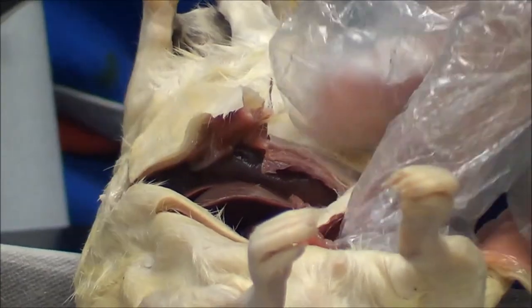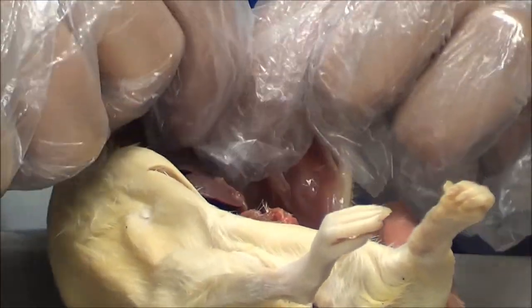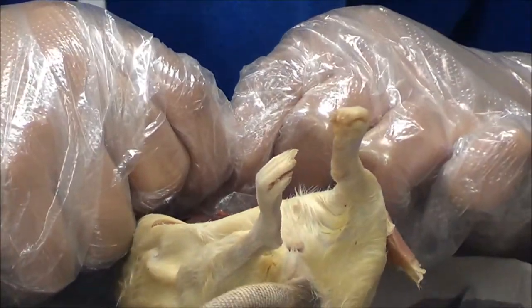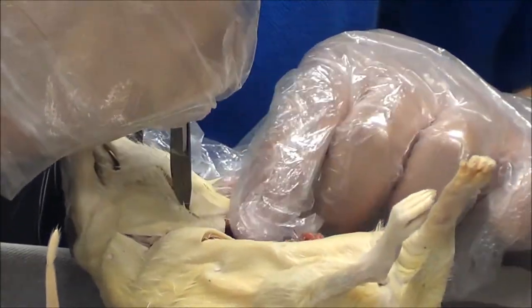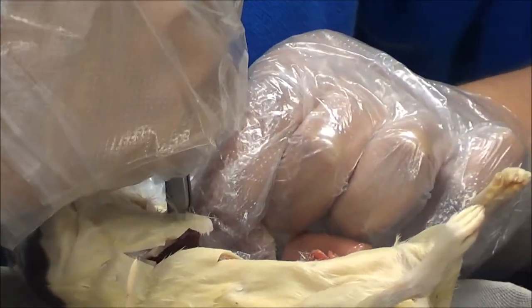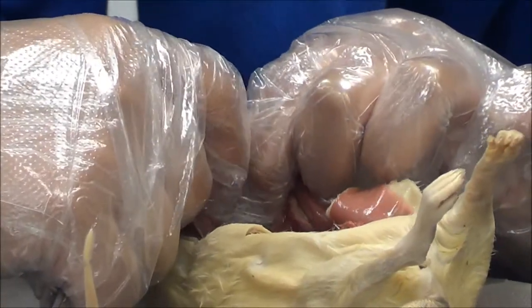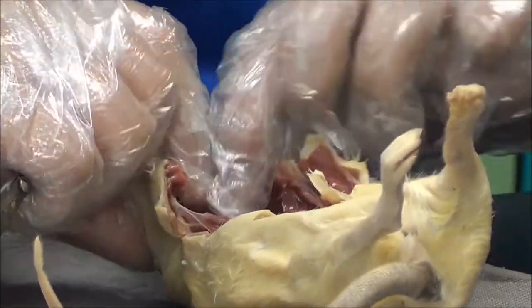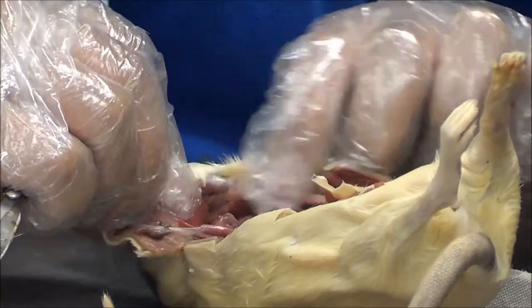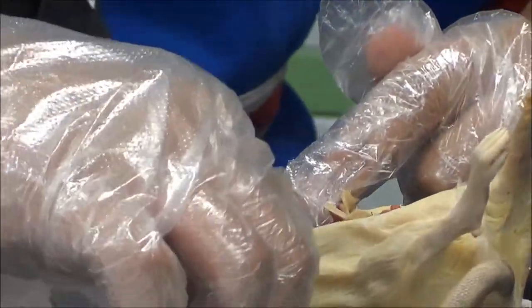Next, I will be making an incision in the rat's rib cage. First, we must open it a little bit wider and then make the incision — not too deep, of course, because you might puncture the heart. Once the rib cage is cut open, you may be able to see the heart. The heart looks like a little sack, such as a kidney would in a human being.